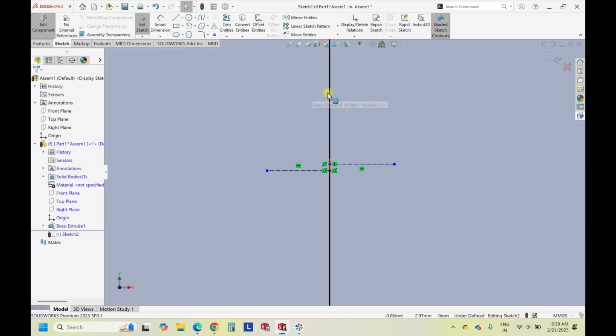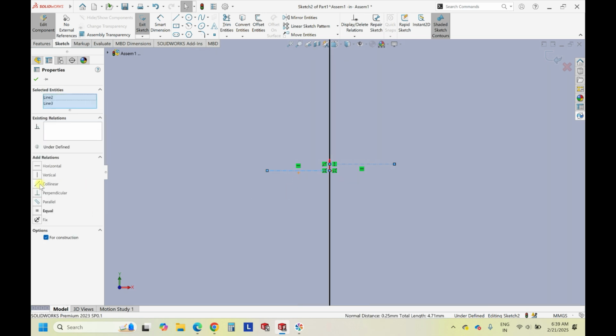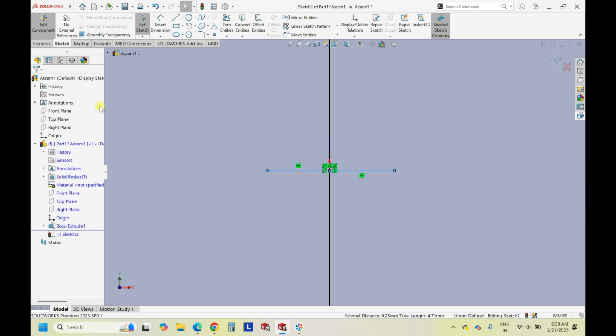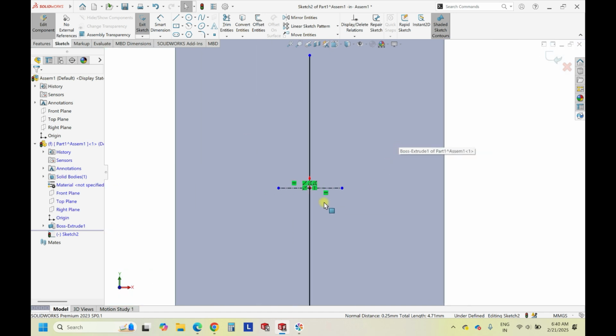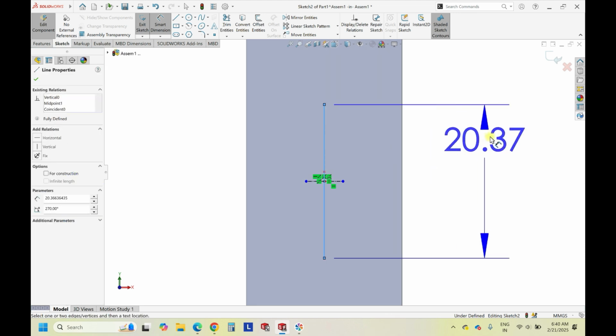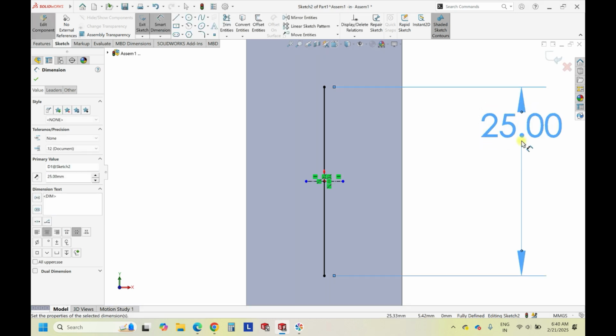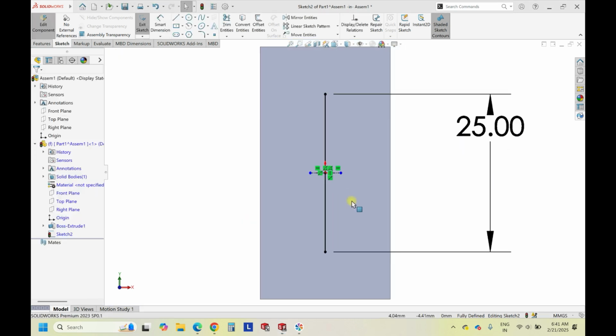So initially I just drew a random line, and now between the center of the random line and the center of the origin, I'm just giving a collinear relation so that now the line is in the middle. Right. And after that, let's give the dimensions of this line somewhere around 25 mm. Observe here, this is 25 mm.